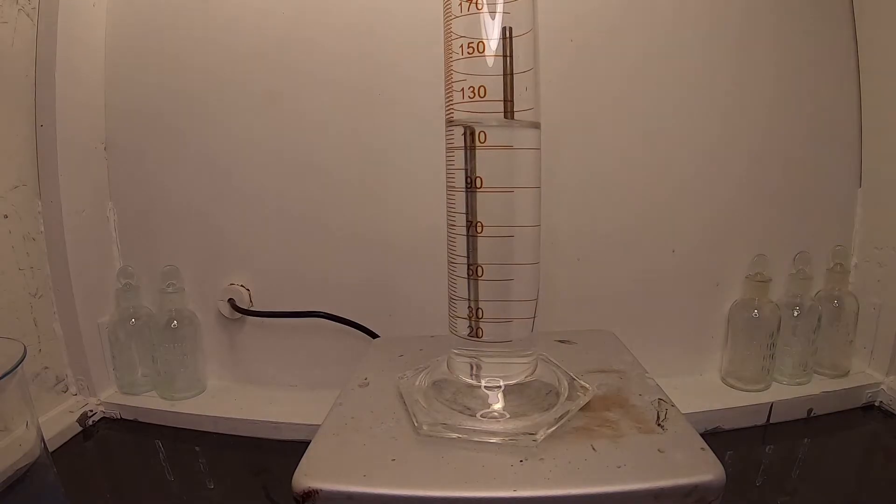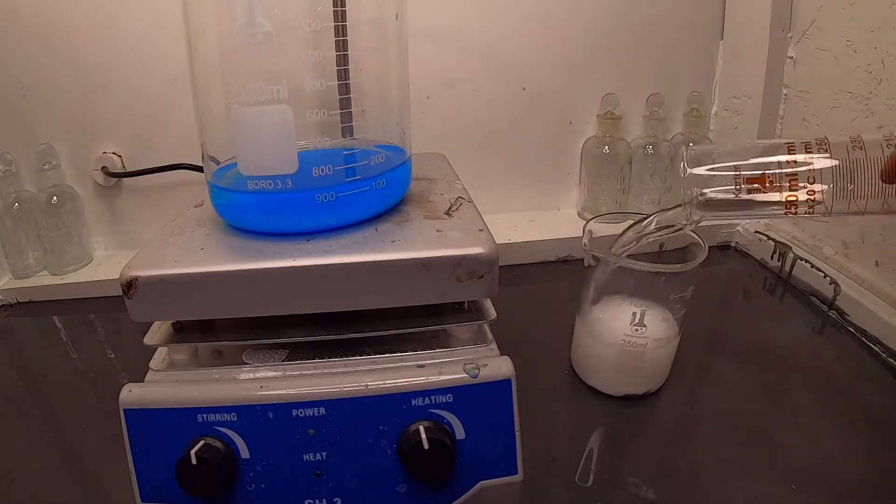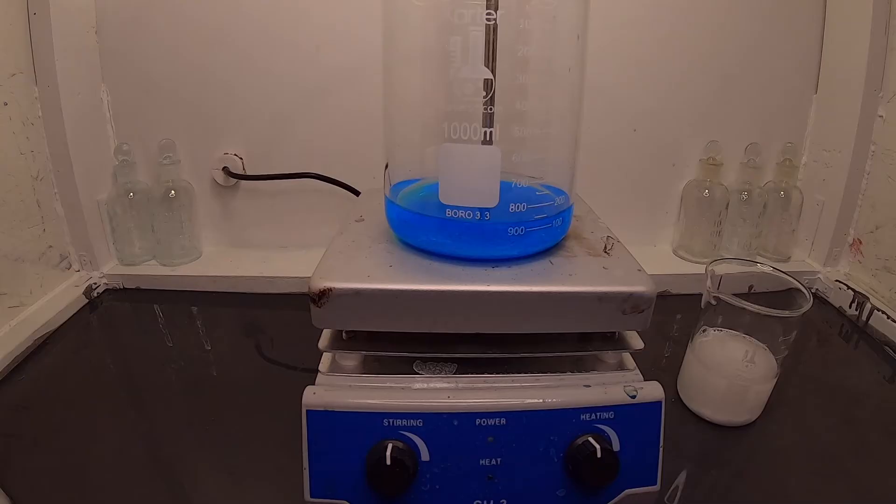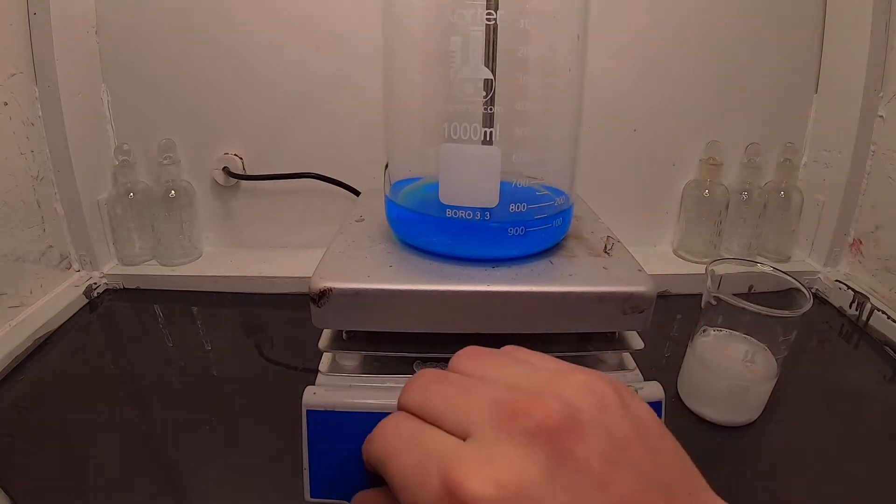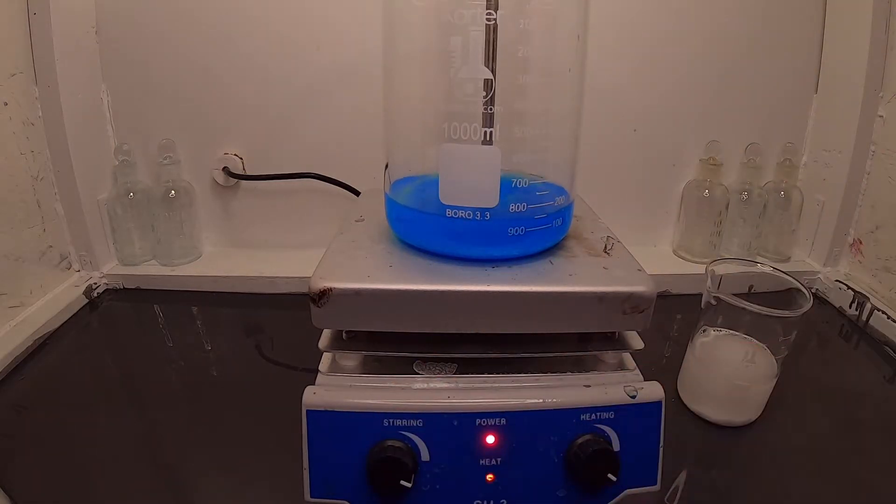120 milliliters of distilled water is added to both compounds making two solutions. Heat is needed to get them both to fully dissolve.